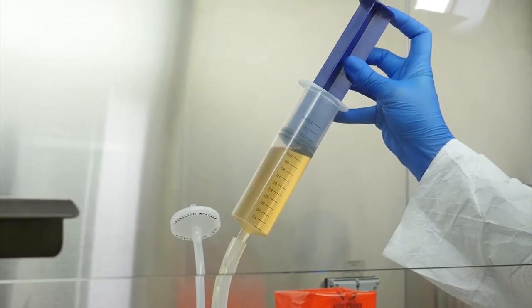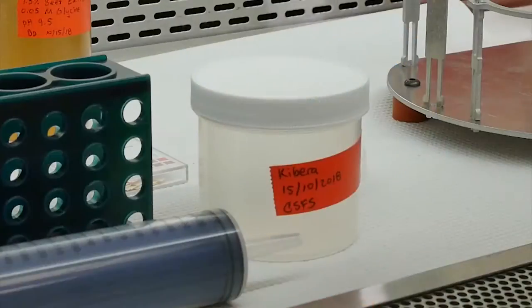Also include one syringe for eluent injection and a collection bottle with at least 300 milliliter capacity. This should be labeled with appropriate sample identification information.